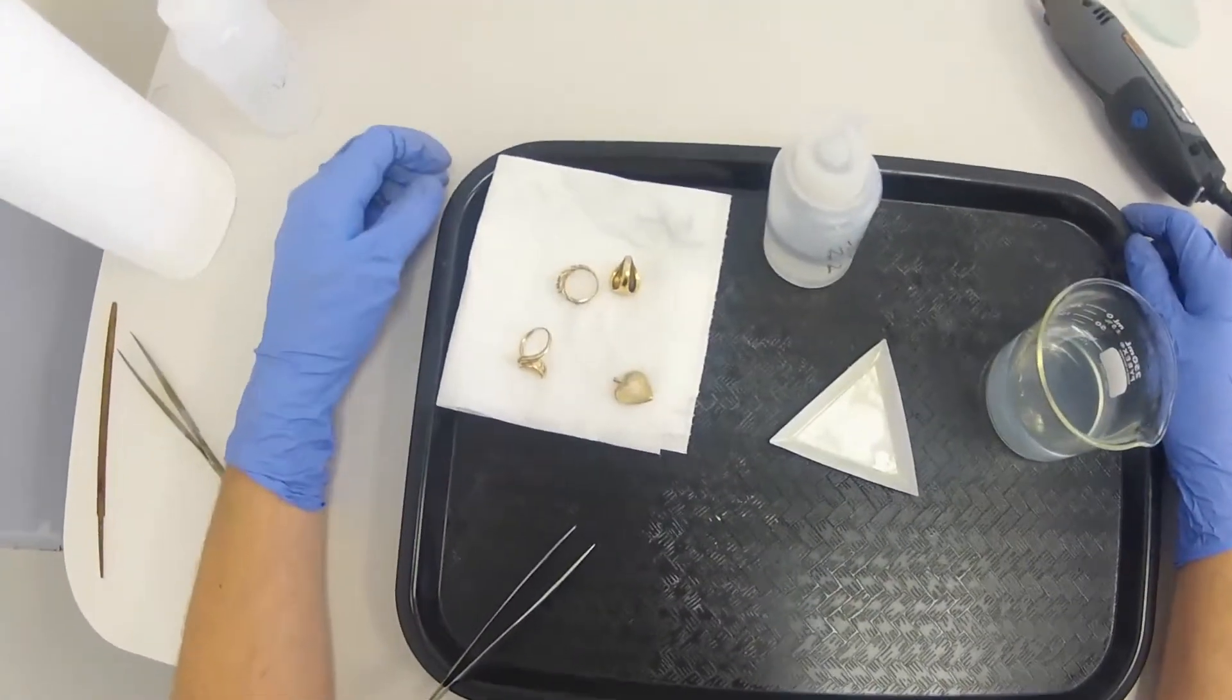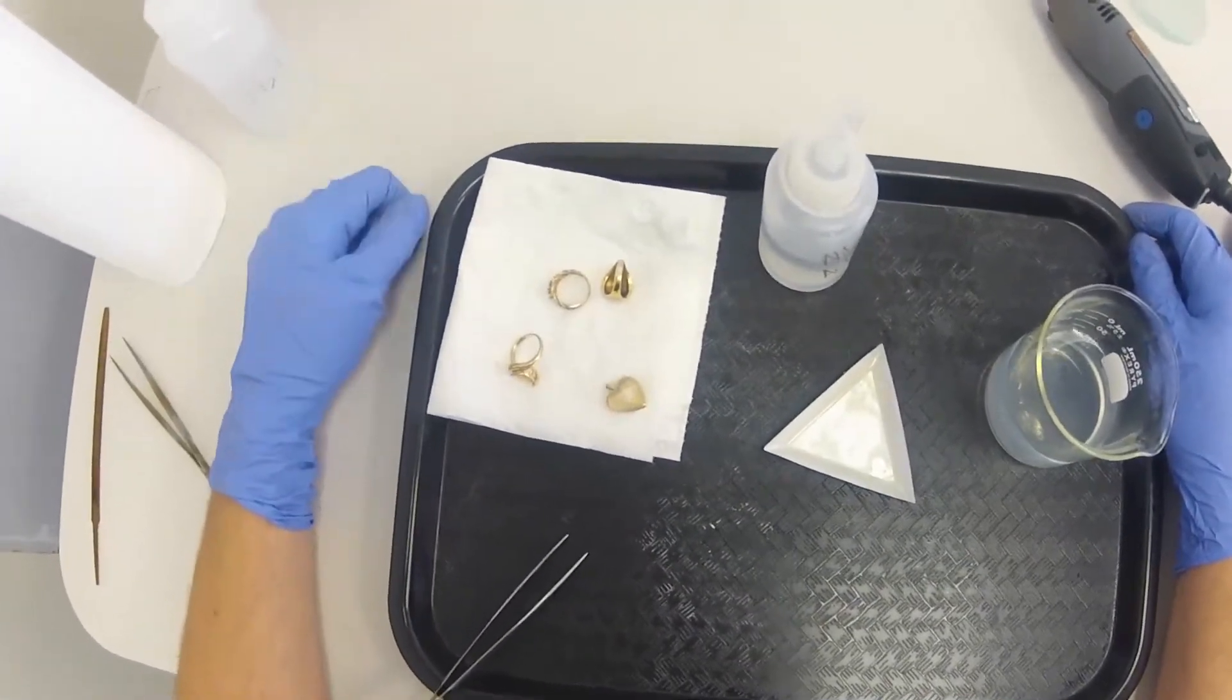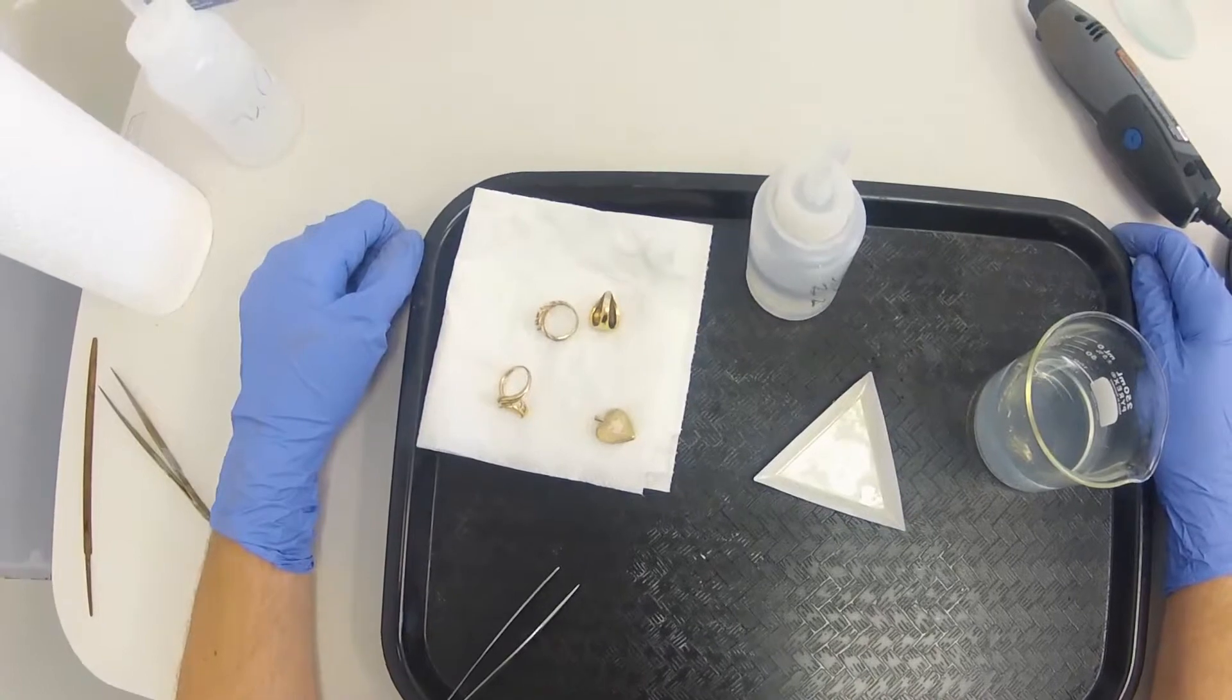All right, so I've got a few pieces of gold here I'm going to test and show you guys what we expect to see.